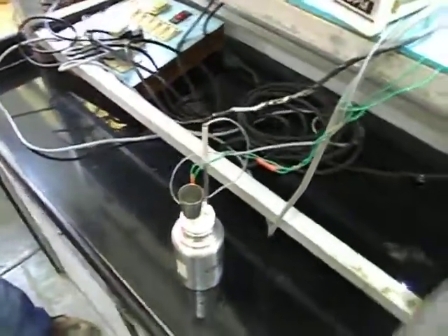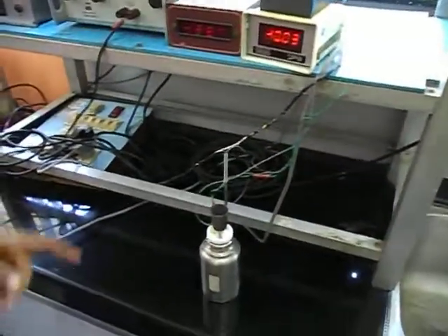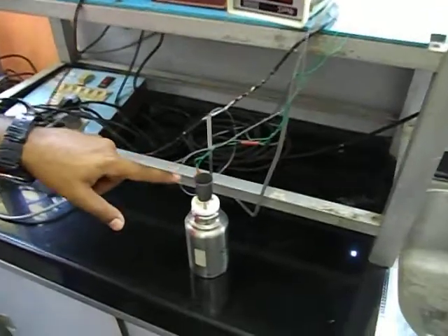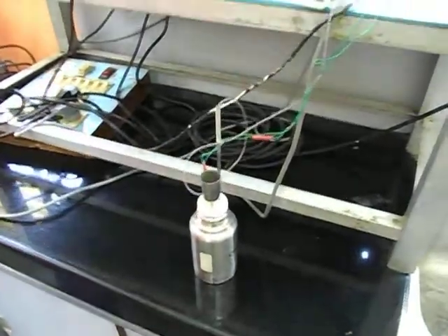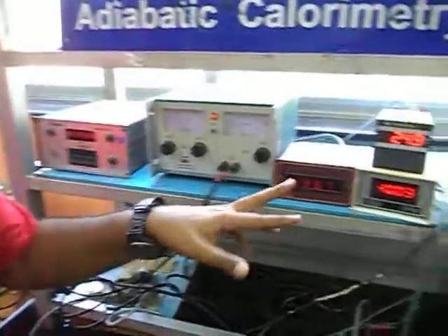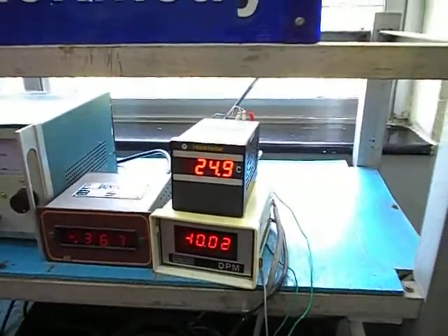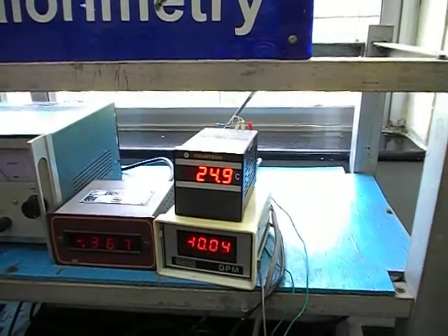So at first what is done is that the first fluid is entered into the funnel and we wait until the temperature reaches a stable temperature, that is it attains thermal equilibrium.